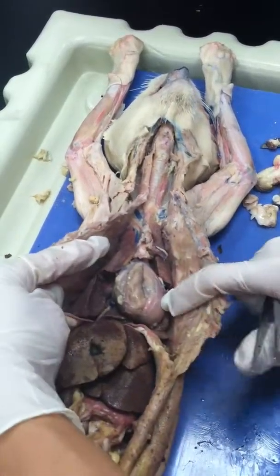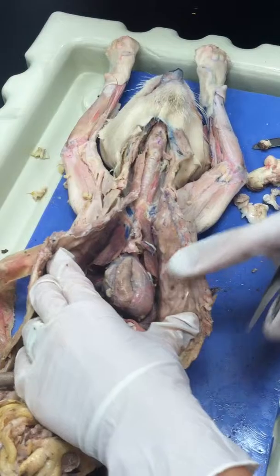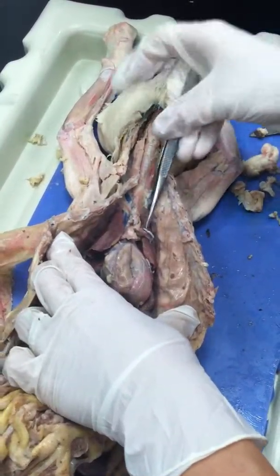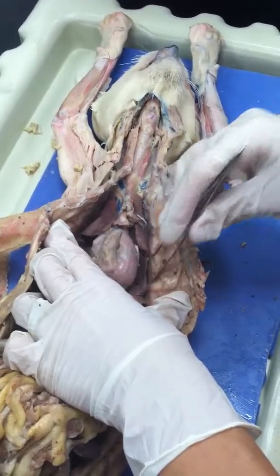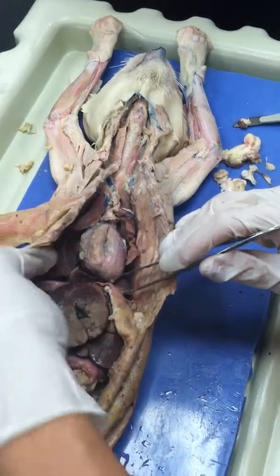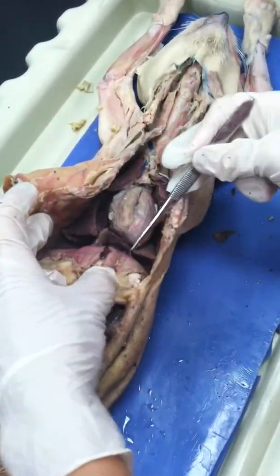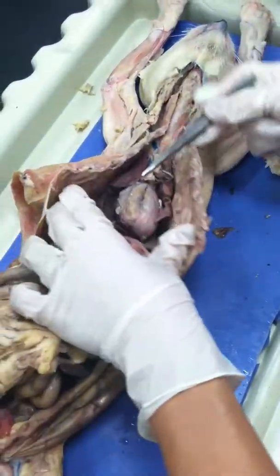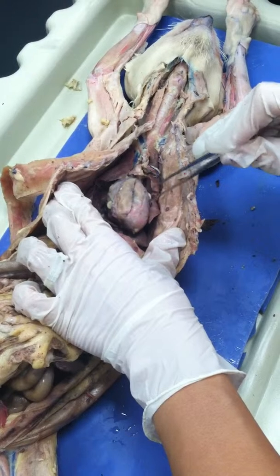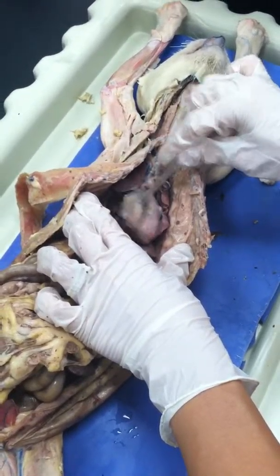Excuse me, doctor. Yes. Can you please speak a little bit louder? Because it doesn't get transmitted. Okay. So the two lungs, as you see, have more than 3 or 4 lobes. Below the lungs are the diaphragms, these two, and then you have the heart covered by the pericardium. It's difficult to find any of the details of that heart.